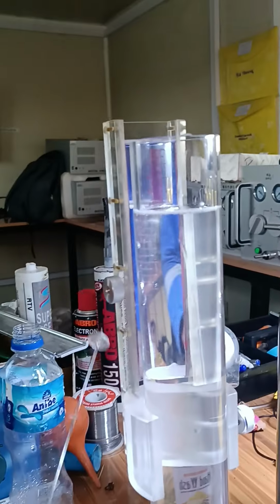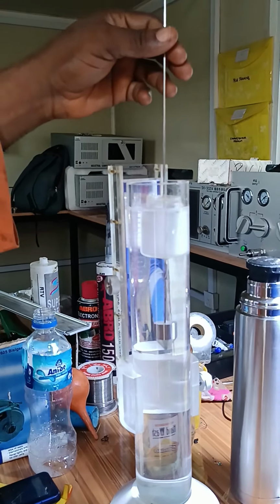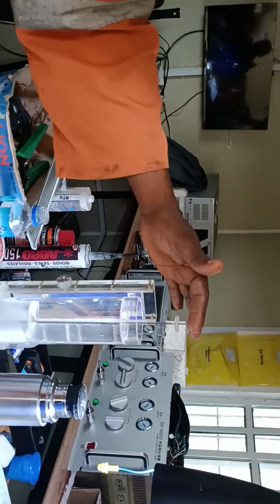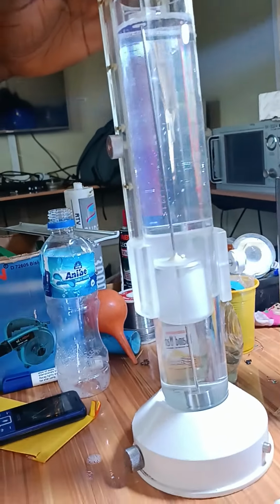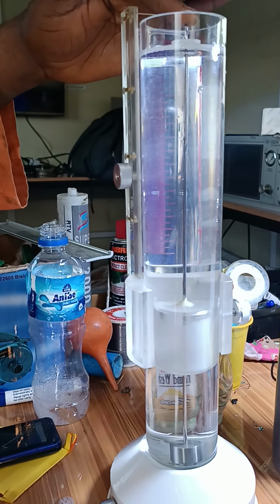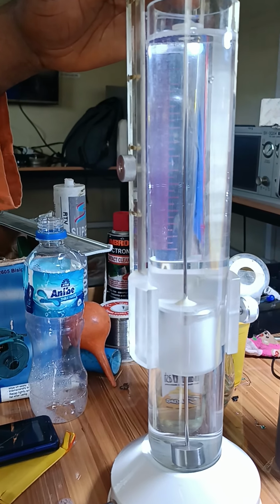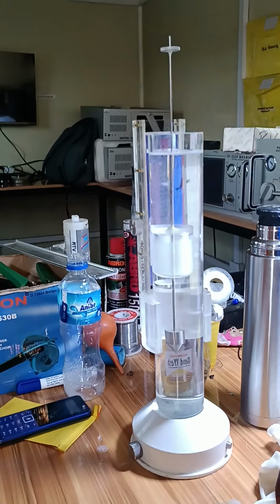Then what next? You put this floater in it. When you put the floater in and allow it to dip to the bottom, you see the hammer is touching the bottom now. It must not be more than 2 cm from the top after dipping the floater. You can see we're having about 1 point something cm, which is very okay. This is what you must have before you start the measurement. So you allow it to come to rest.